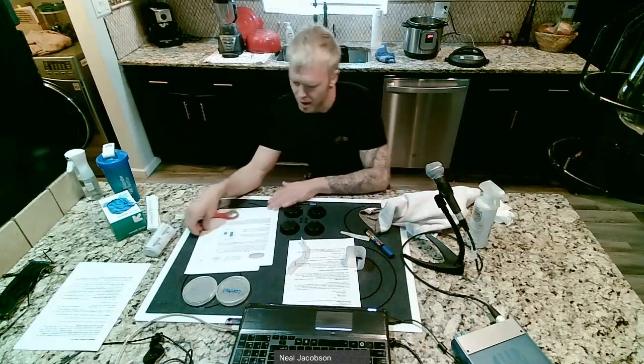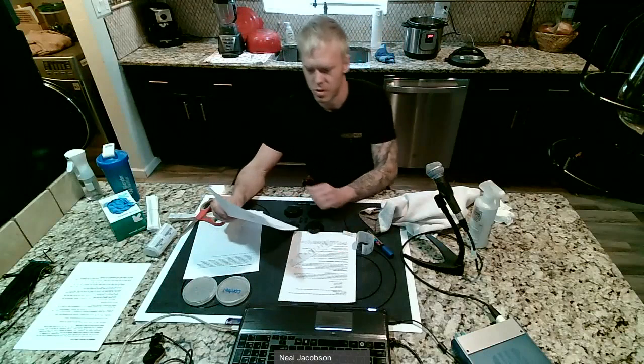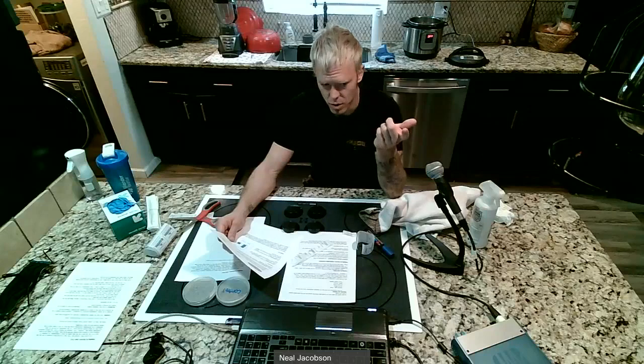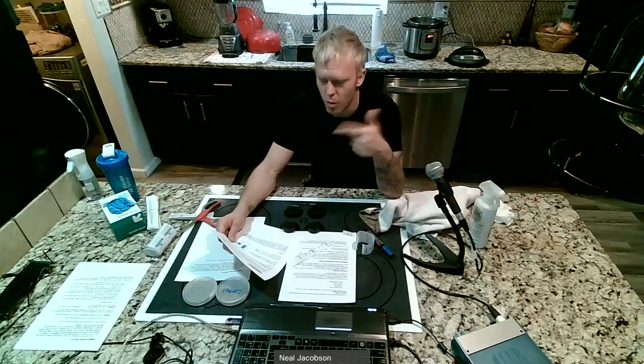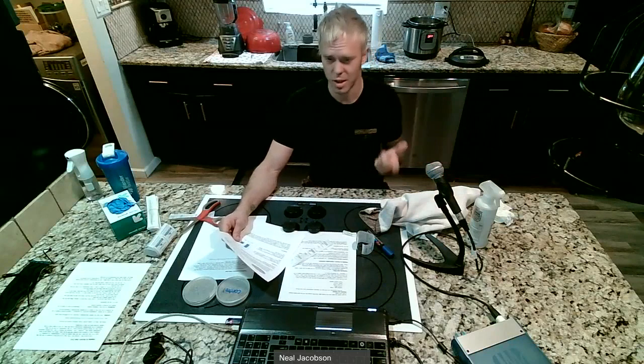All right. Prediction. So we can make a prediction. I'm on page 3. We can make a prediction about our hand washing. Based on my hypothesis, my experiment is going to inform my prediction. So my prediction comes from my experiment. My prediction will be about the diversity and the number of bacteria that are present on the plate. And that supports my hypothesis or it rejects my hypothesis.